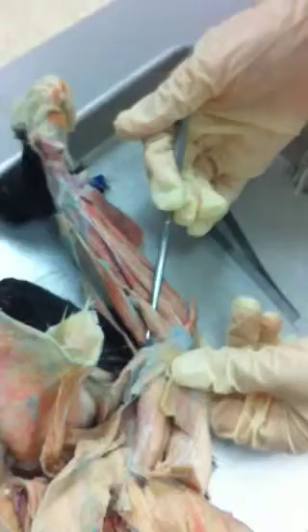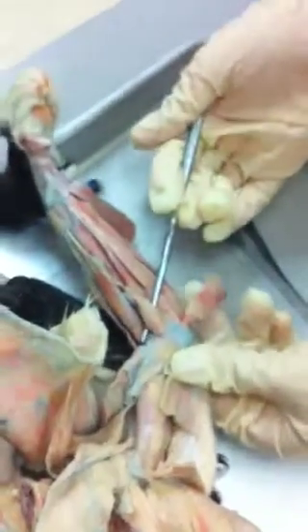And we have our brachioradialis. We are guessing this might be the pronator teres, but we are not entirely sure right now, so don't take this as fact.